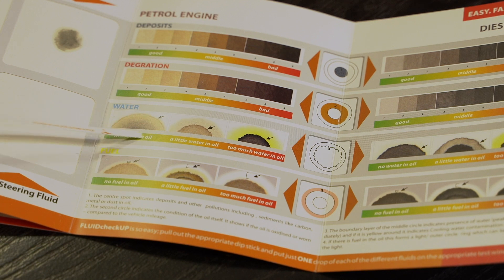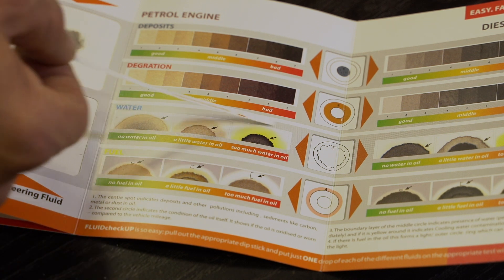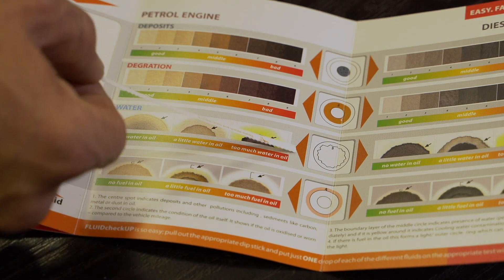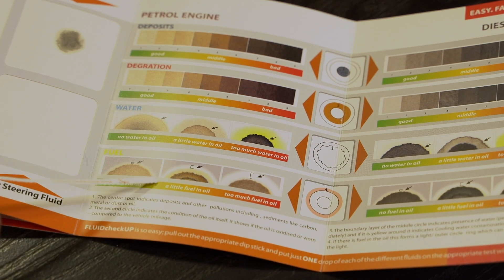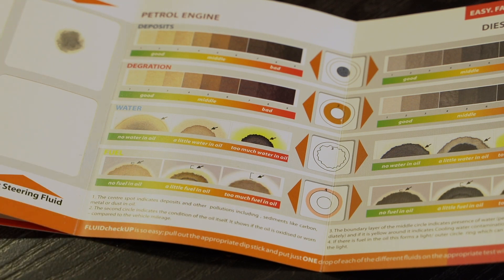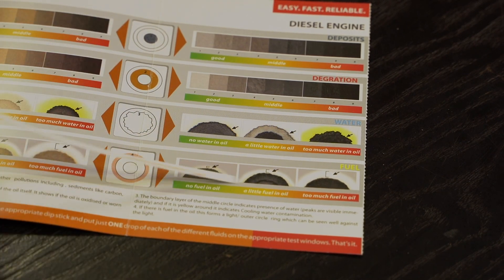For water contamination, pretty good condition is indicated by a small shadow on the outskirts of the oil drop, then it gets a little bit worse, and worse again. When you start getting excessive water contamination, you start seeing a yellow-type boundary around the oil swab. For fuel dilution, there's a white shadow that starts to form, and that gets worse and worse the more fuel dilution is picked up inside the oil. The same indicators apply for diesel — deposits, degradation, water contamination, and fuel dilution.